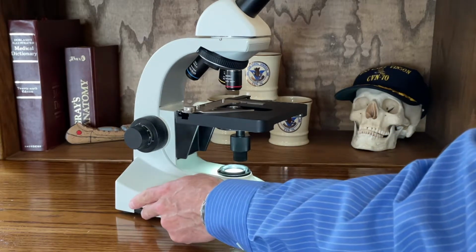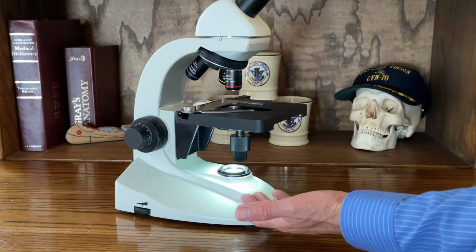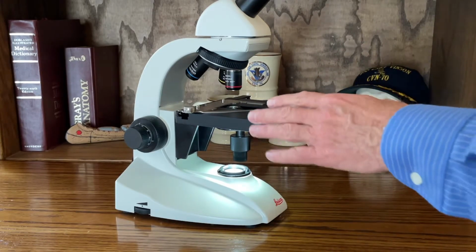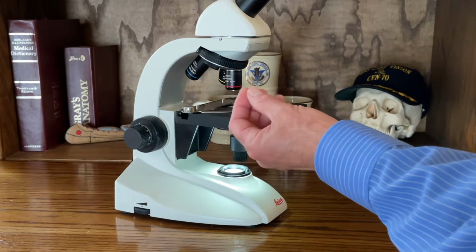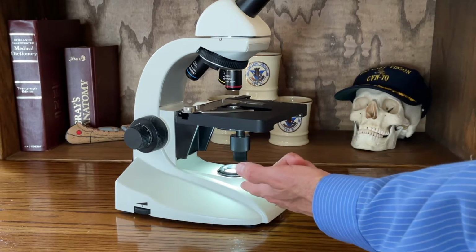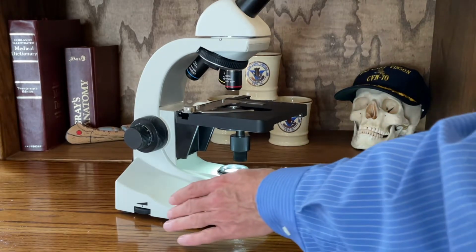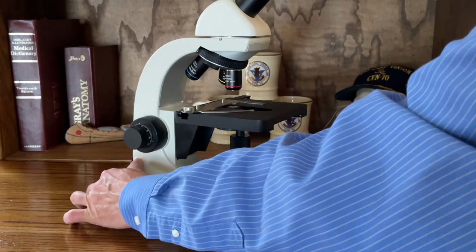So you want to be careful when you're using a light microscope, because realize it's projecting light from underneath up through a tissue sample. That tissue sample is usually just one cell thick or so, and that allows the transfer of light, which will then allow you to see the stained tissue sample on the slide. So as things get magnified, so does the light. That intensity will get amplified. You don't want to burn your retina. So always start out with the light at a very low intensity. I'm going to turn it off here now.